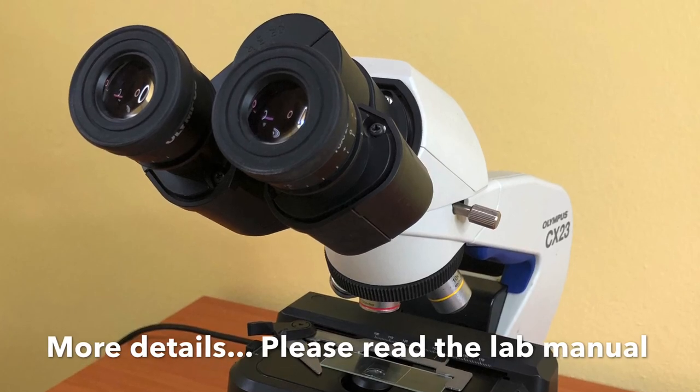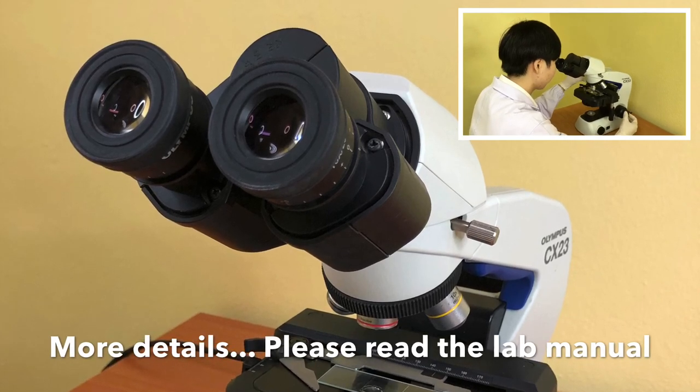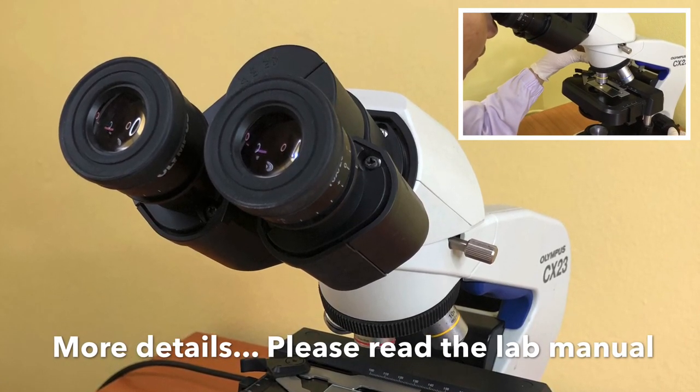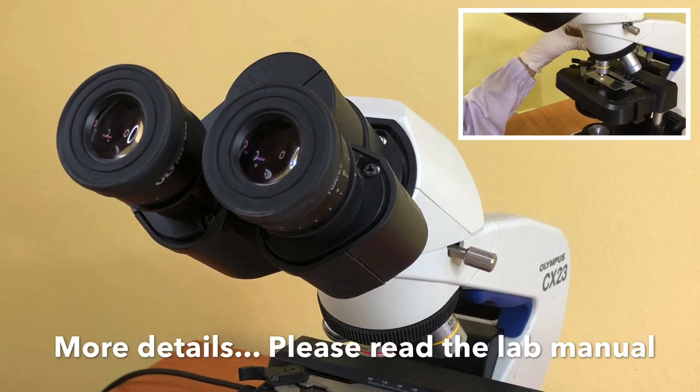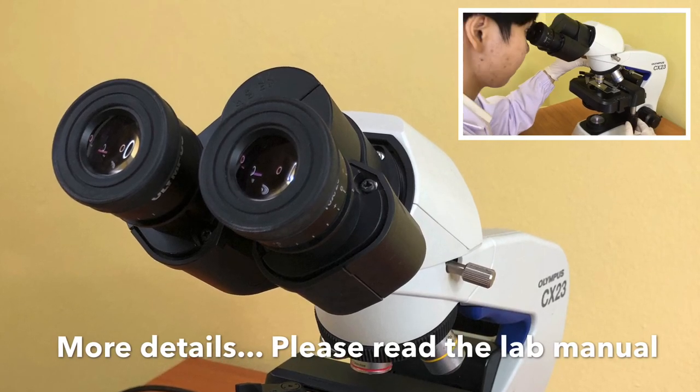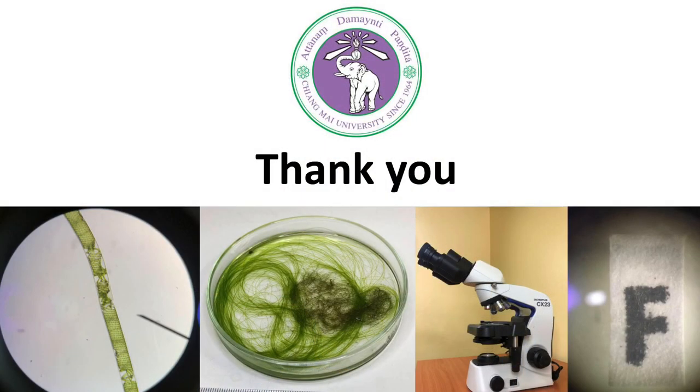This video covers only some topics of how to use microscope properly. You have to do further studying of how to handle and use a microscope. Make sure that you read all information in your lab manual.